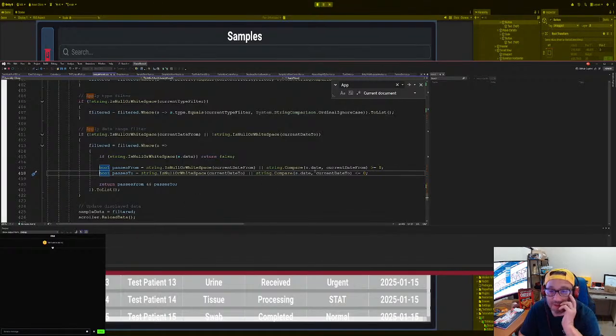Okay, let me make sure the date. Compare the date, the S date, to the to date. If it's less, okay, so we are comparing. Okay, so we are comparing the date to the to date. If that is less than, oh, let's see.